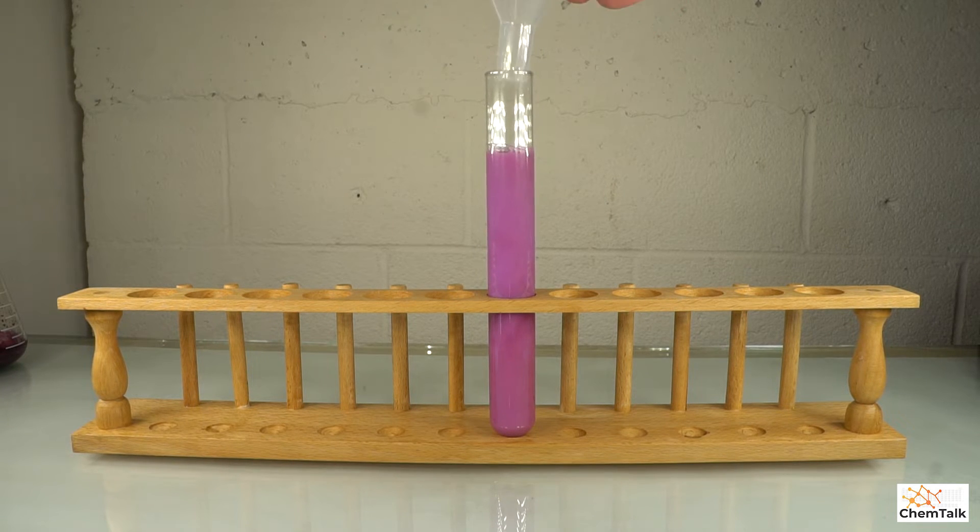I'm going to move this out of the way. And we are going to give it a minute and I'm going to see if this settles because if this settles, we're going to see two really, really beautiful colors of this solution.